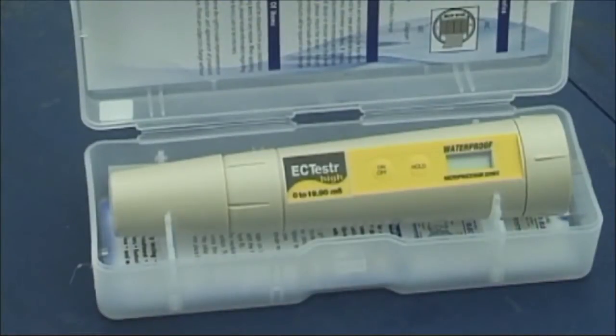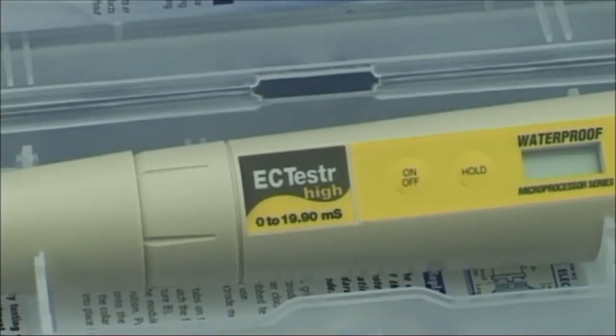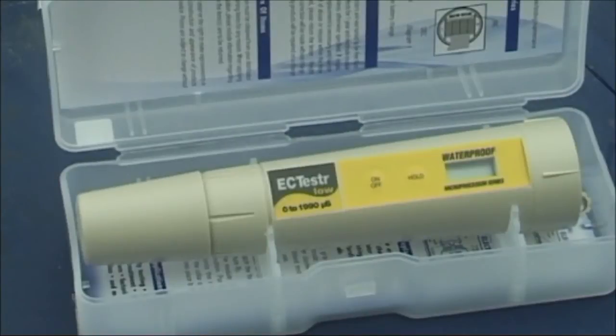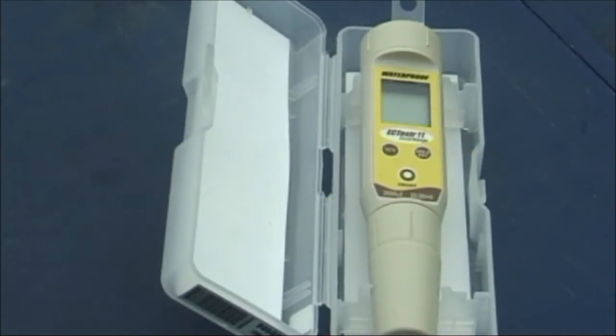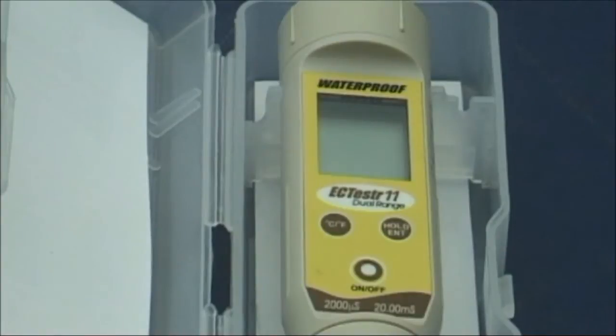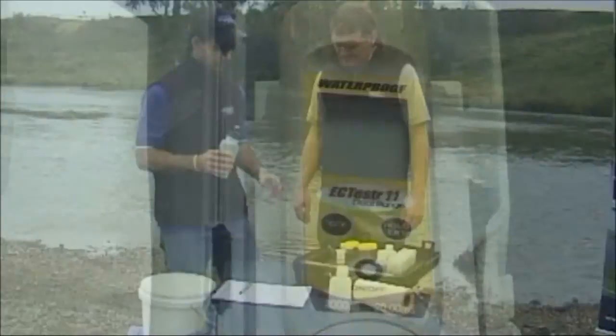Some meters measure in millisiemens per centimetre and some in microsiemens per centimetre. Dual range meters measure in both. Check the units your meter measures in.